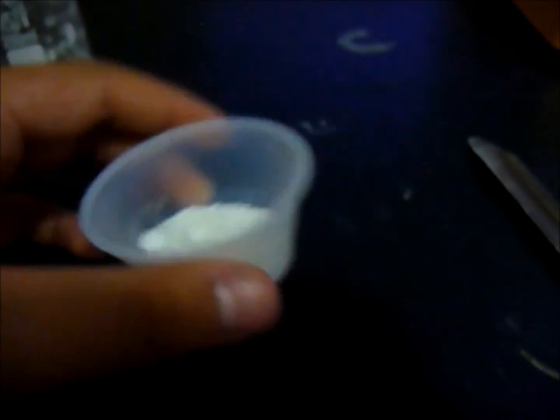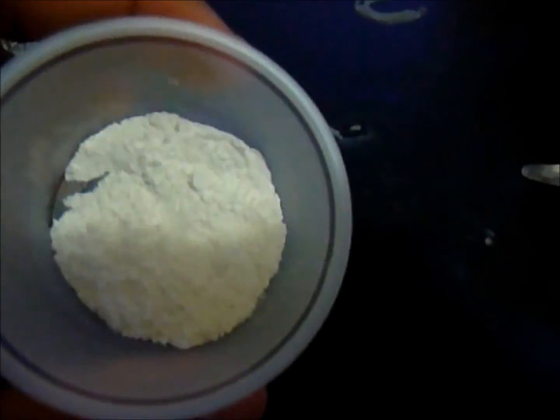This is the finished product. The next thing to do is to grind it with the mortar and pestle. Now that it's to a powder, the next step is to put it in a container.